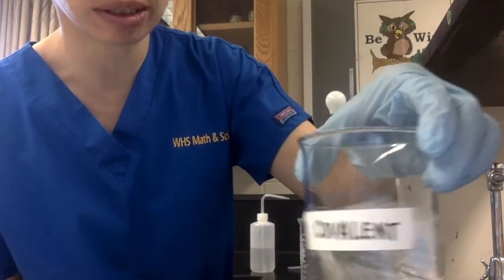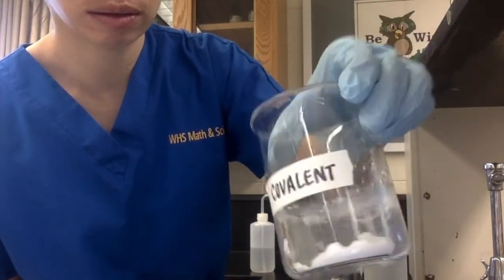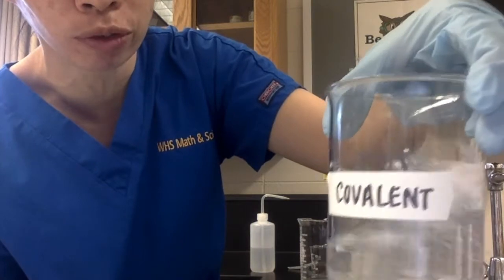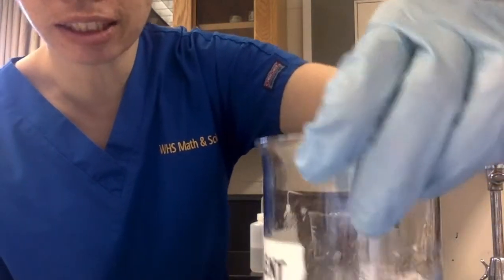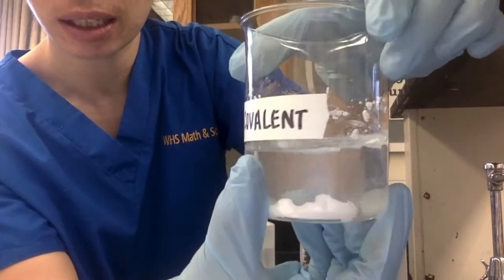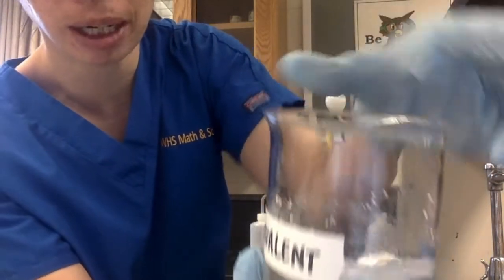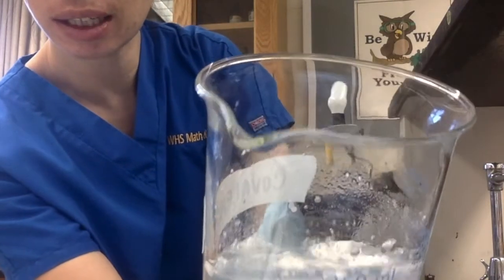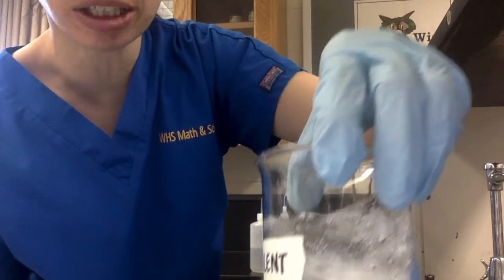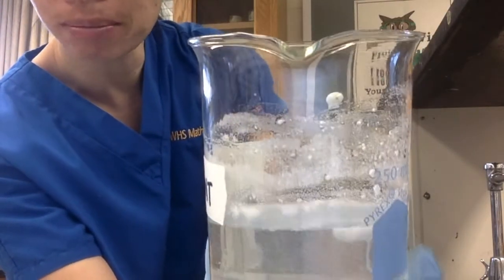And then I'm going to start to swirl. And you can actually see it's staying as a little clump down here. I can't even move it. And then there's lots of particles, kind of clumps floating at the top. Sorry, I should do it this way. Oh, there we go. It finally came up. See how there's all this gunk at the top here? It doesn't really look like much of it has dissolved, if any. It's floating on the top, not really mixing with the water.